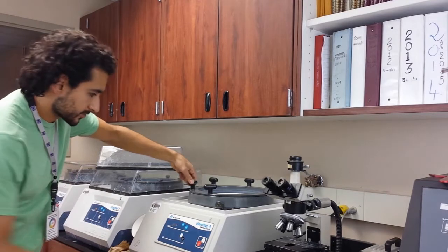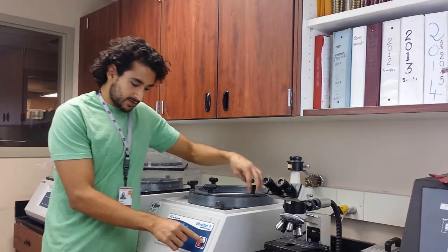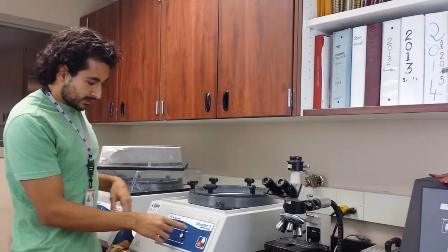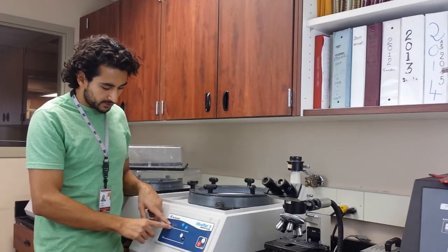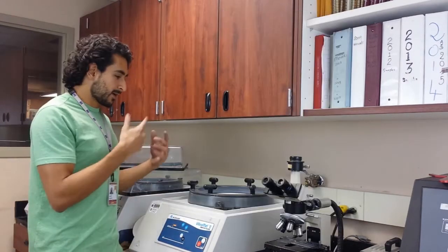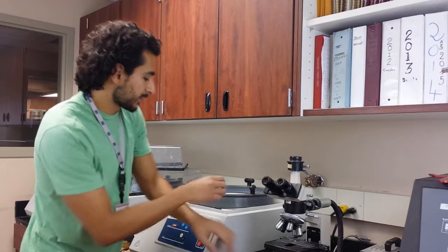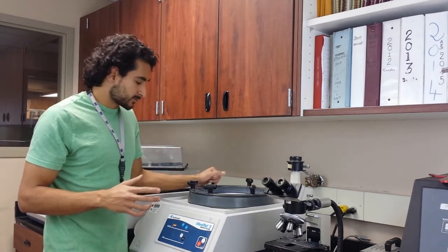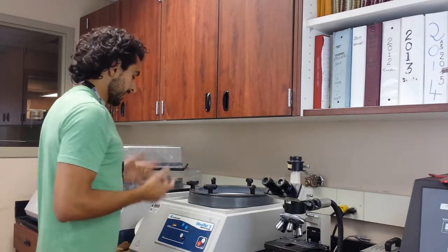And then you turn it on right here. Oh, I unplugged it earlier. You turn it on right here, you tell it to cycle or stop your cycle, but you first need to tell it the amplitude. So I want to go about 50%, and with the white button it starts, you hear that, it's vibrating, and it seems a little loud. When it's too loud, and you can tell, you need to tighten these a little more. But it seems to be okay right now, that's more or less the tone you want, and this is ready.